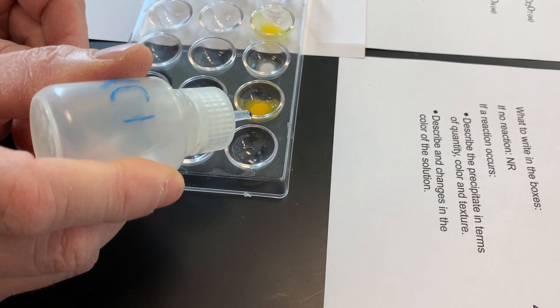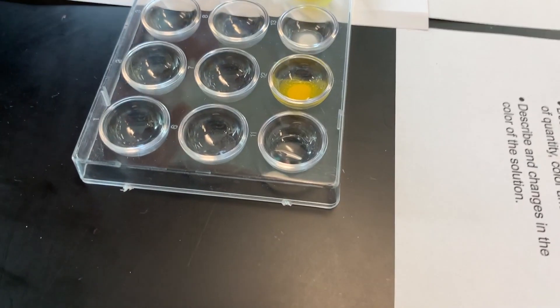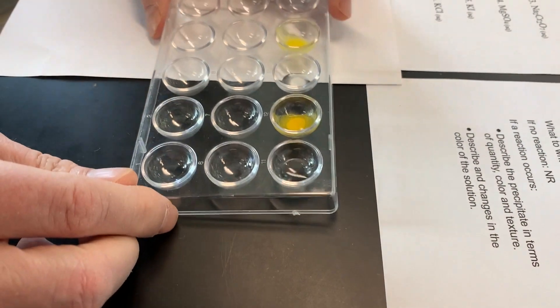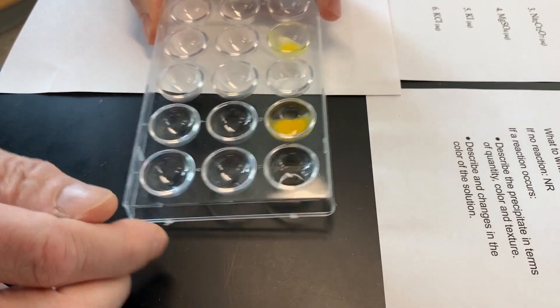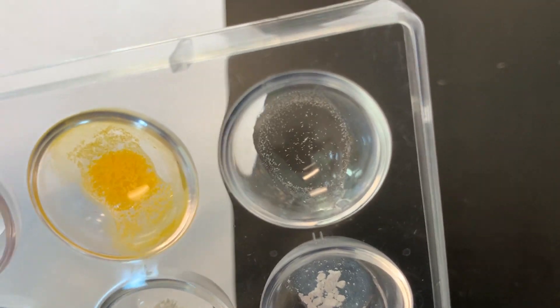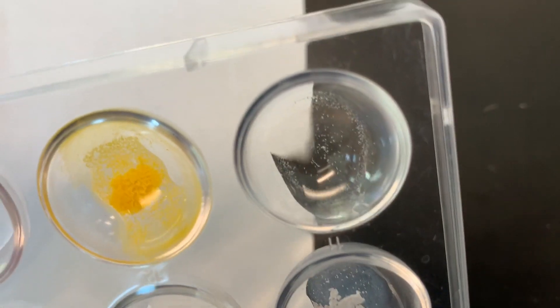And four drops of potassium chloride. Three, four. This one actually isn't going to happen for a little bit of time, so we'll come back to that and check. Okay, took a while but there's a little bit of white powder in there.